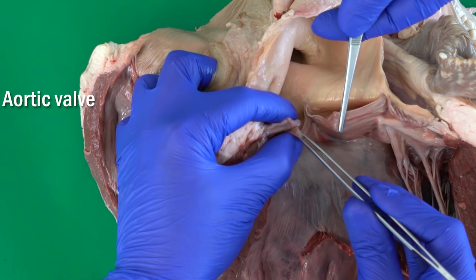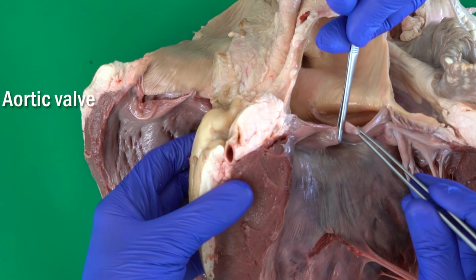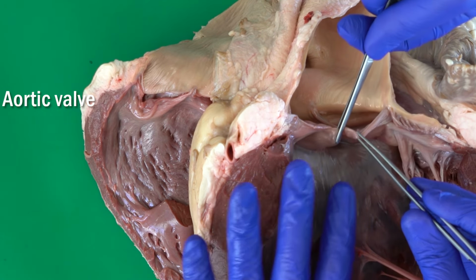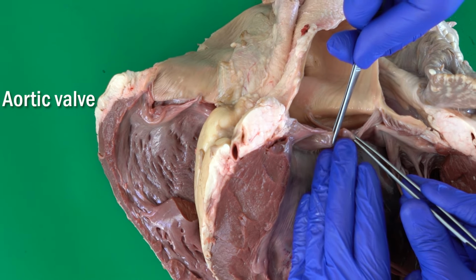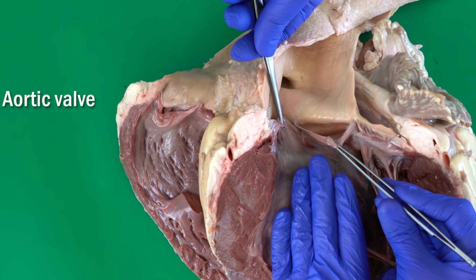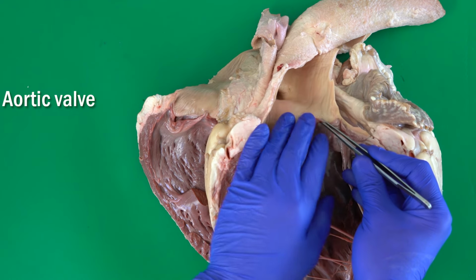Together they form what's called the aortic valve, exactly in the same way we described before. This allows the blood to move from the left ventricle toward the aorta. As you can see, once I put my hand here, I push this valvula to the wall, allowing the blood to go to the aorta.